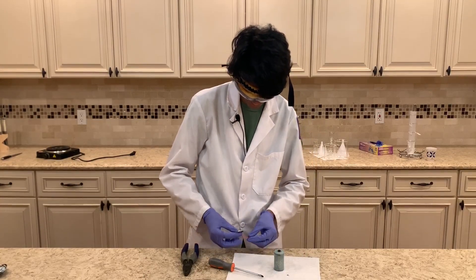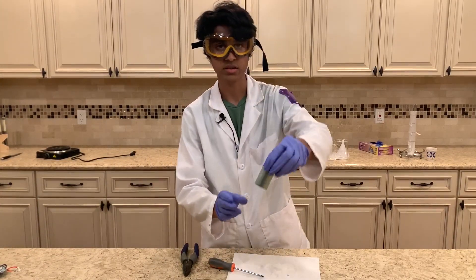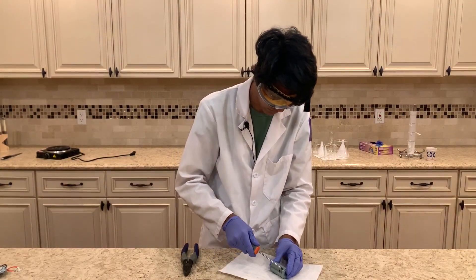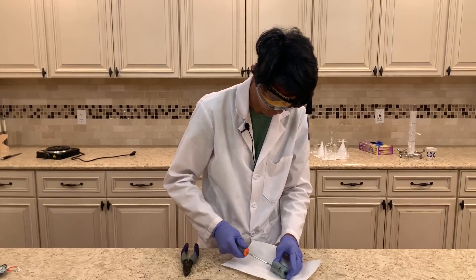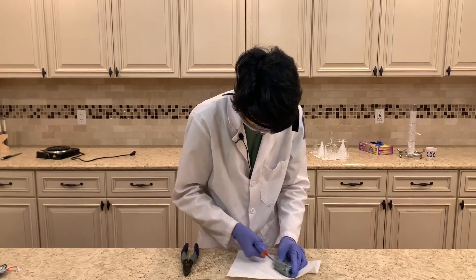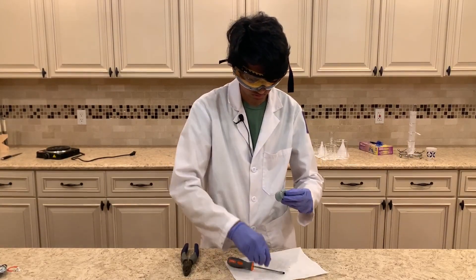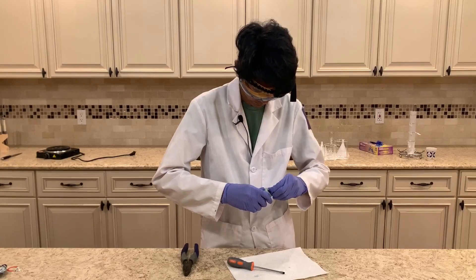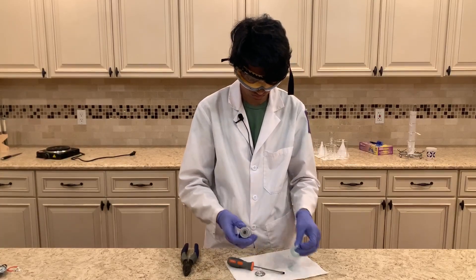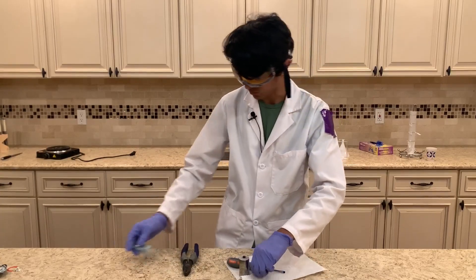The top came off too. This is more stuff we're not going to need. Now you can see there's a plastic casing that we'll have to take off as well. You can just cut it with the screwdriver, and once you cut it you can just peel it off. The plastic is off and some more of the caps came off.